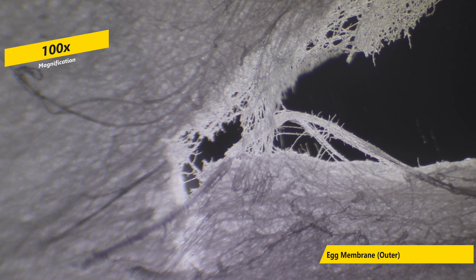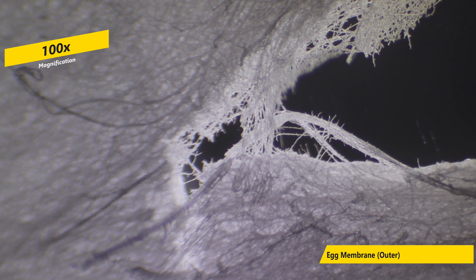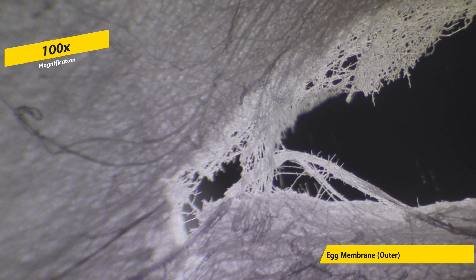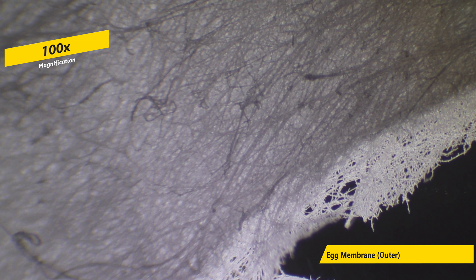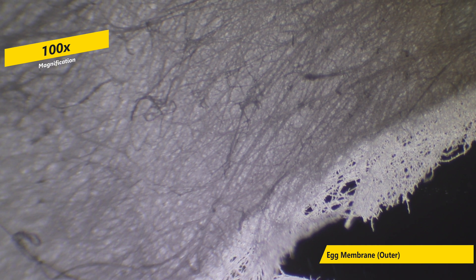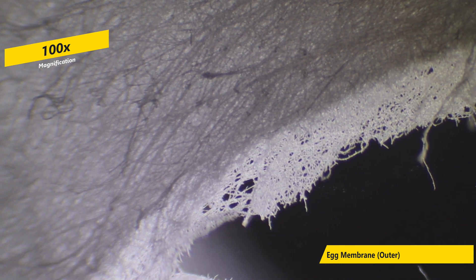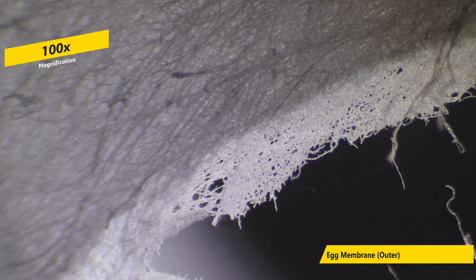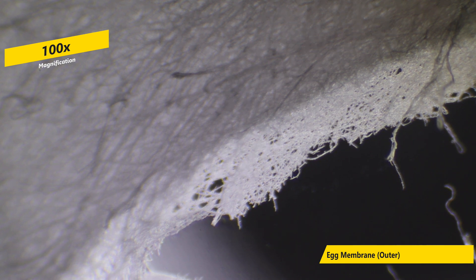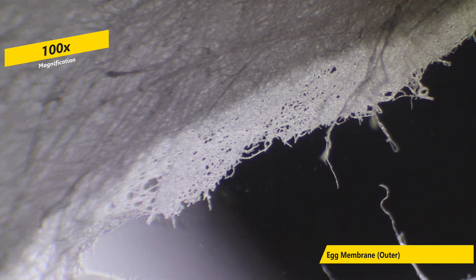Next is an image of an eggshell membrane. This is a thin layer that you usually see when you try to peel back a boiled egg. It consists of two layered, reticulated structures where the exterior is rough while the interior structure is dense.